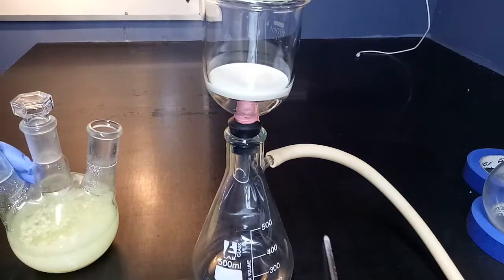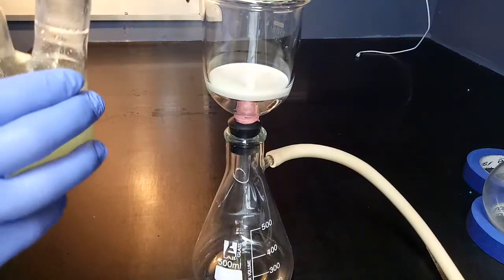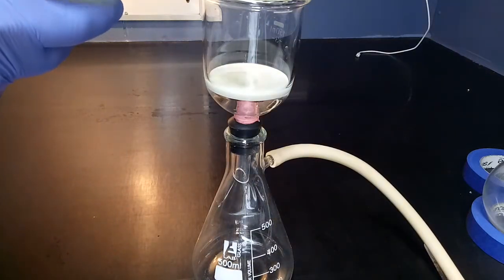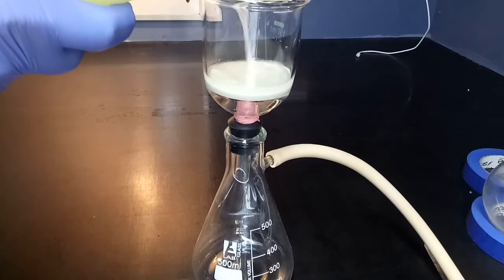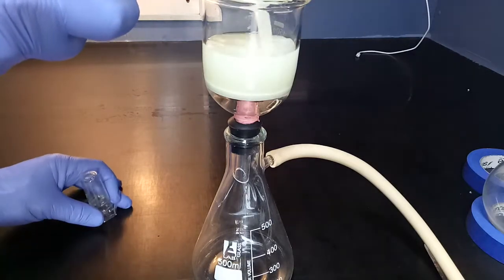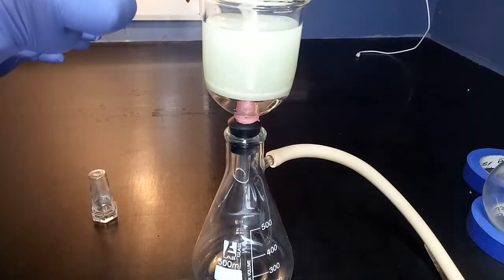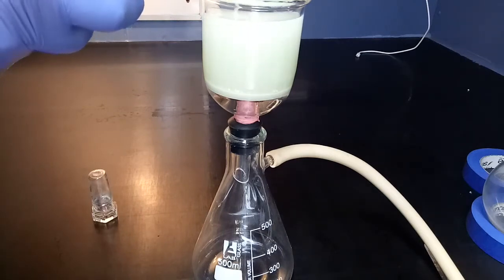Yes, that is the bottom end of a chair leg and some teflon tape holding my funnel together. It's amazing what you sometimes need to do to make things work, and repurposing lab gear out of household items is just one of those things that you have to do from time to time.